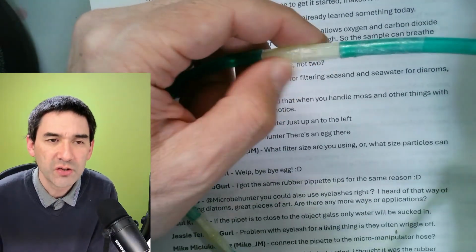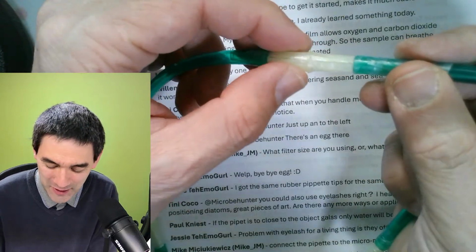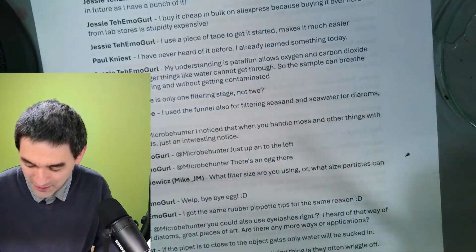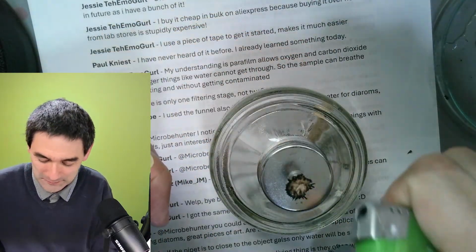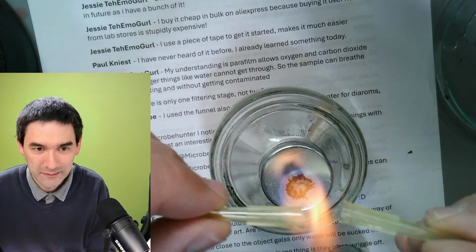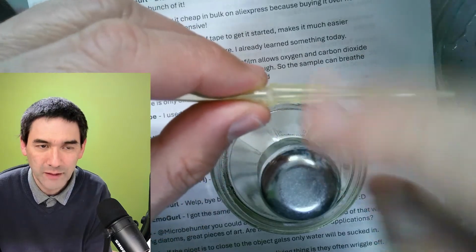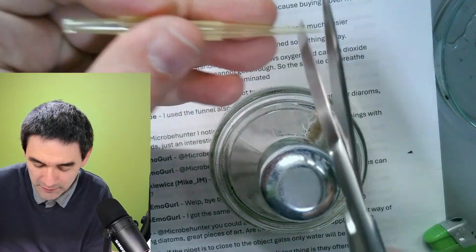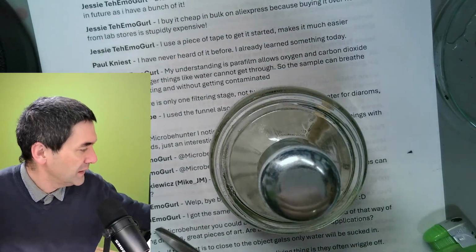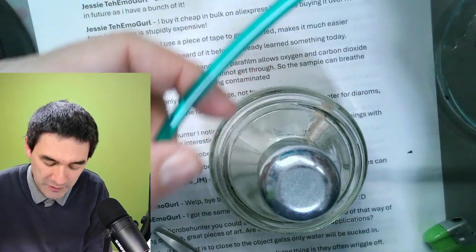You might wonder why these strange things here. Well, because I only had short tubes, and I connected them together. I can actually show this to you just for the fun of it. It only takes a minute or so. Always be careful with fire. Okay, look, I melted it and I glued it together like this. Then parafilm around it to really make sure it's airtight. And I basically cut this off, left and right, and inserted this into the tube here, left and right, and then parafilm around it, and that's how I made those extensions.